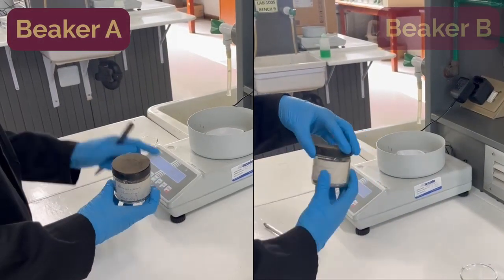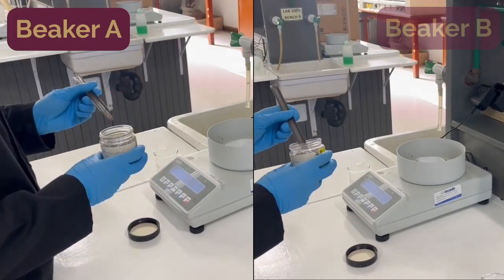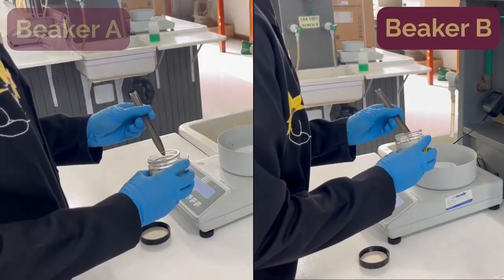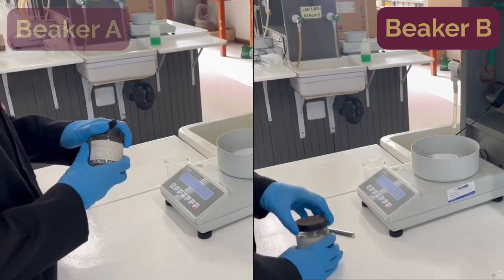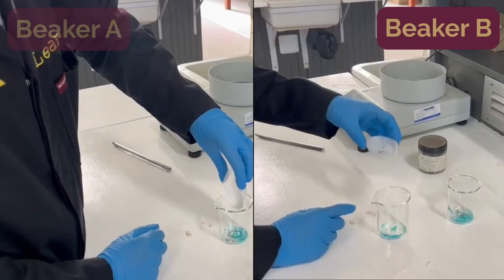Weigh approximately 0.075 grams of the aluminium shavings in the plastic weigh boat and report this exact mass in the data report table. Add this to beaker A. Weigh approximately 0.050 grams of the aluminium shavings in the plastic weigh boat and report the exact mass in the data report table. Add this then to beaker B.